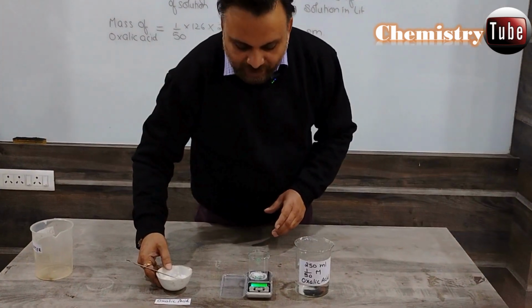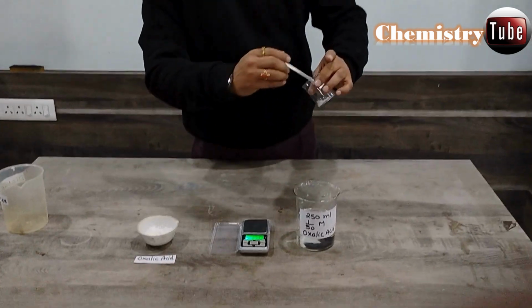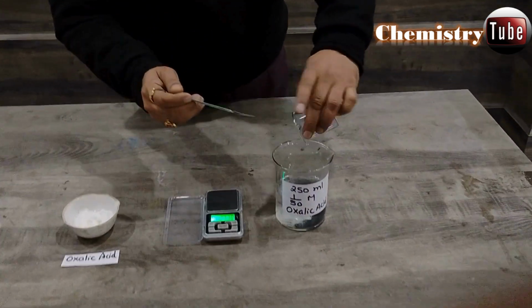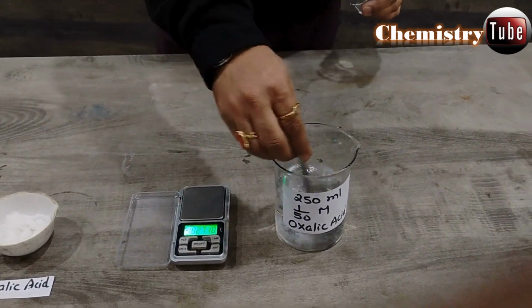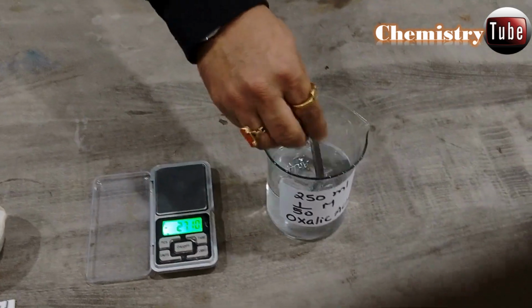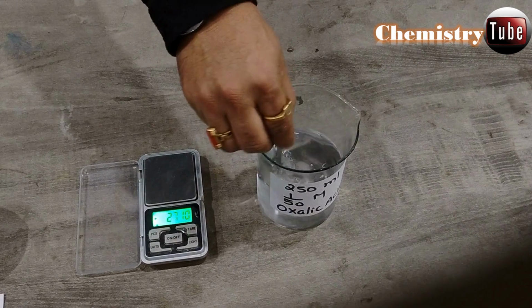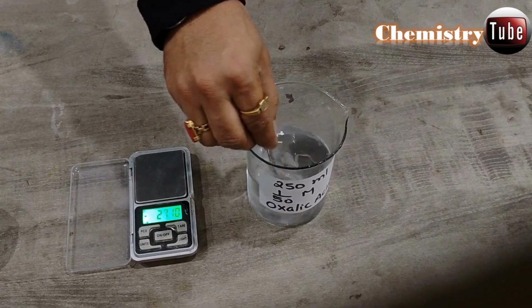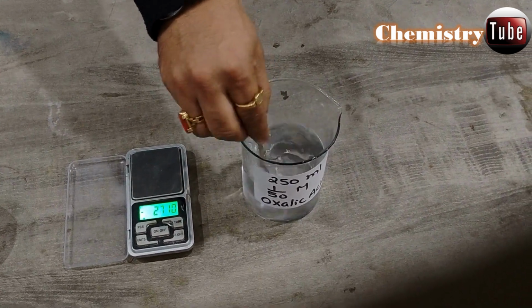Finally, we will transfer this oxalic acid into this 250 ml of water, and we will carefully stir this solution so that we have 250 ml of 1/50 M oxalic acid solution. This solution is ready now.